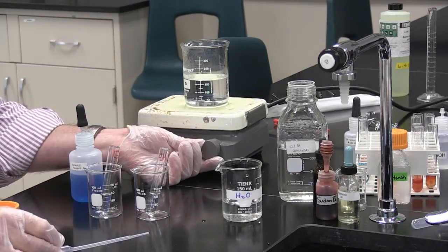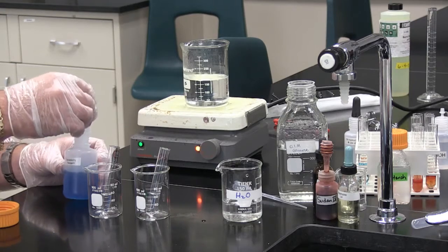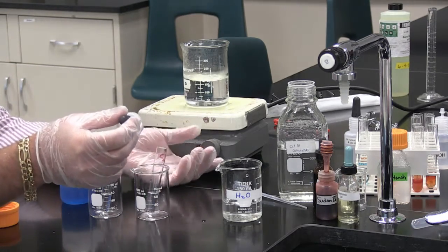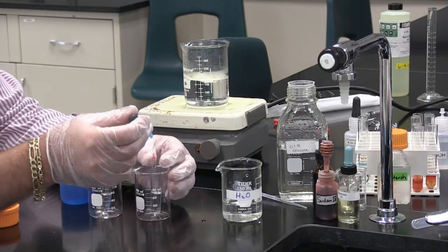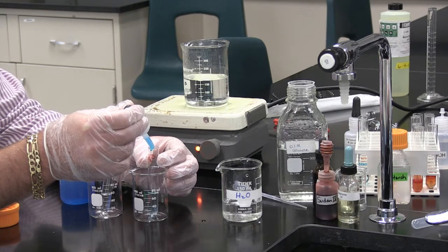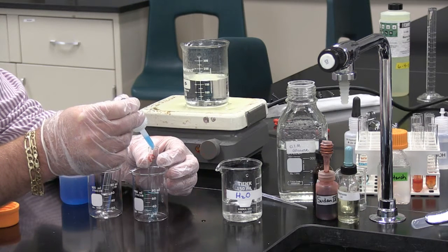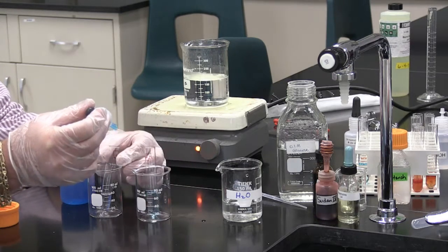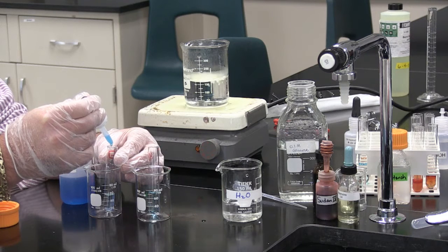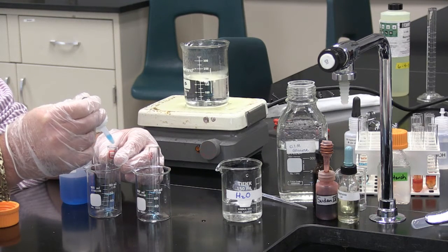For our next step we will add our Benedict's reagent to each test tube — 7 drops into the first test tube and 7 drops into the second test tube.